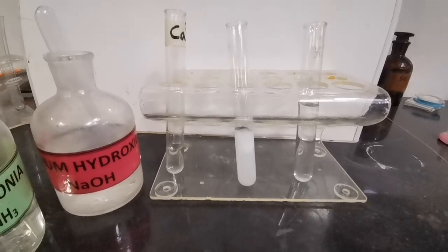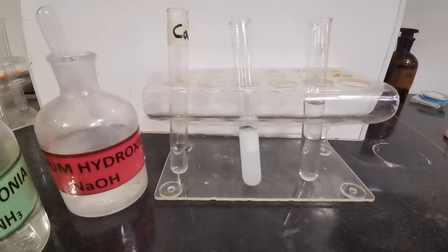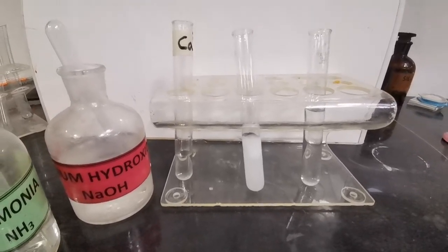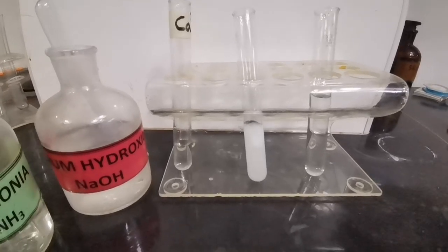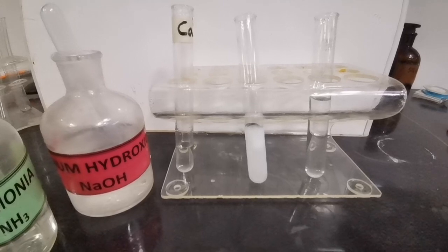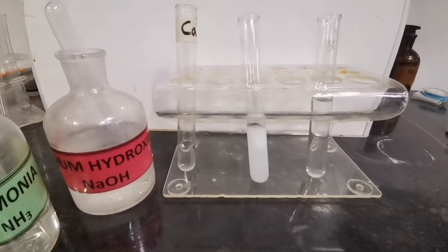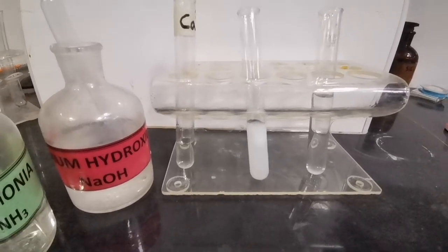The white precipitate does not dissolve on addition of sodium hydroxide in excess, so this test can be used as a test for the presence of calcium ions. For ammonia, we are not getting a proper result — no precipitation is observed on addition of aqueous ammonia dropwise or in excess.